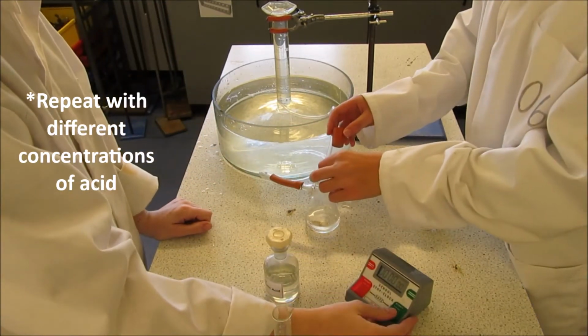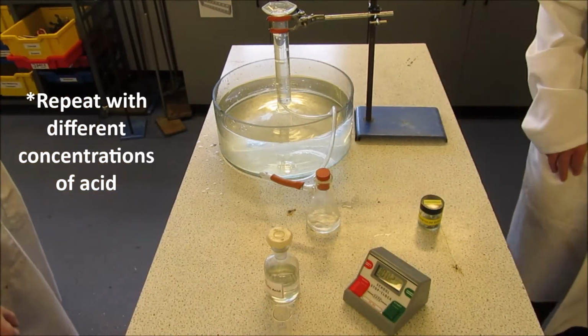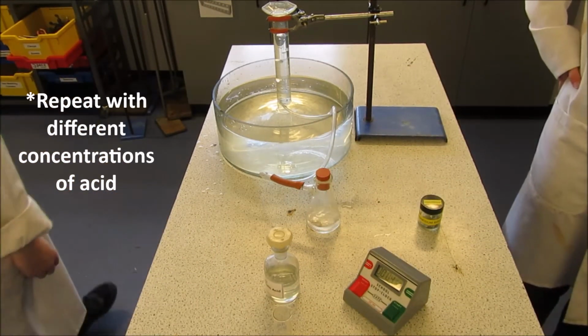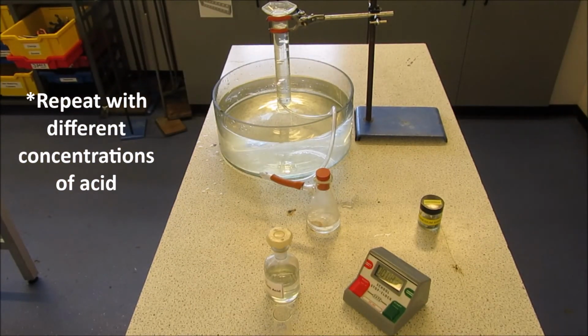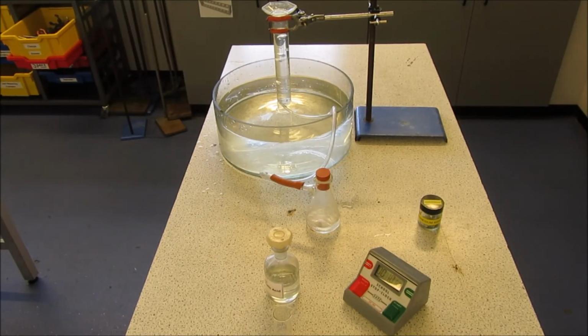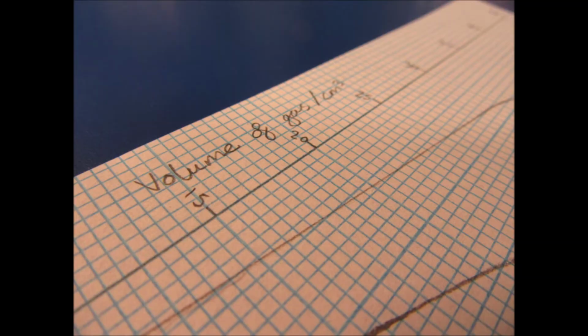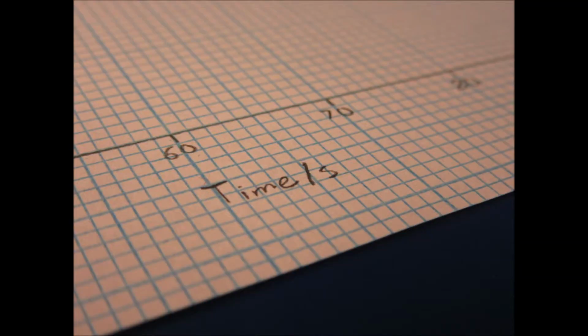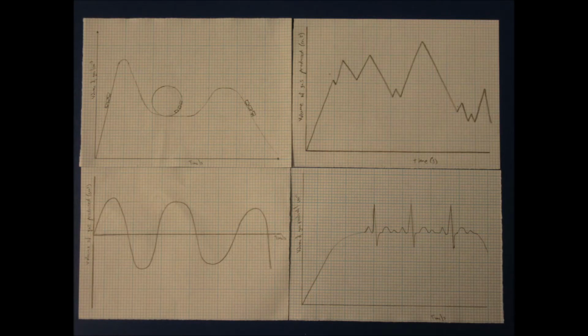Drop the magnesium ribbon into the conical, immediately replacing the bung and starting the timer. Record the volume of gas produced at suitable time intervals. Now plot a graph of your results. The volume of gas produced should be placed on the y-axis with time along the x-axis. Now plot a curve of best fit through your points. You may need several attempts.